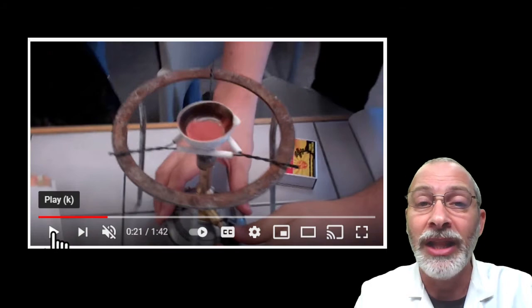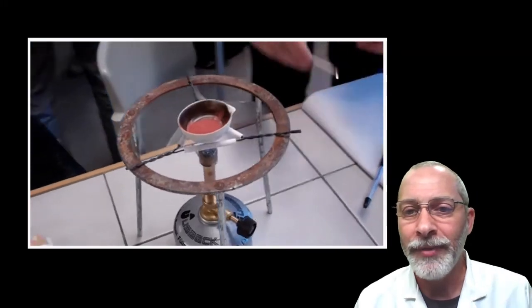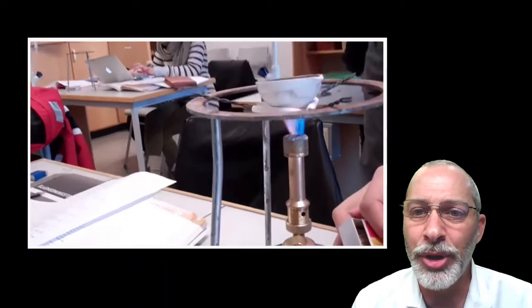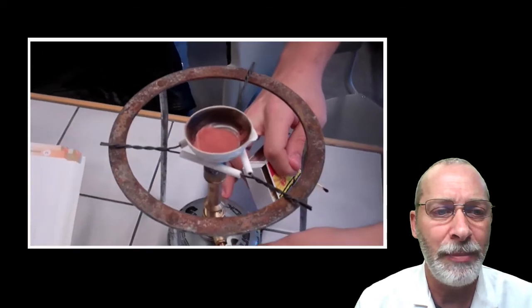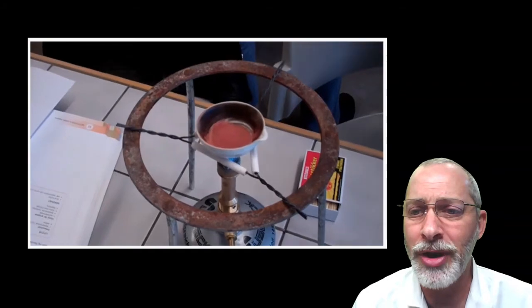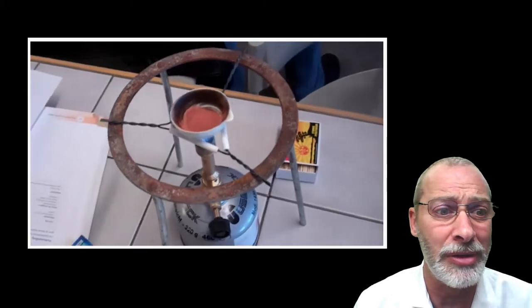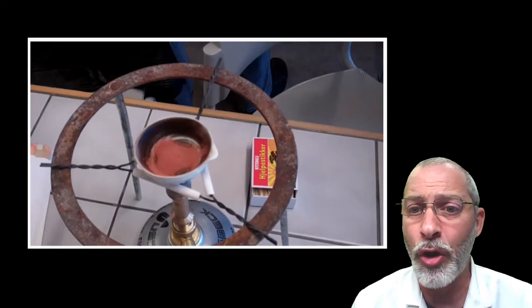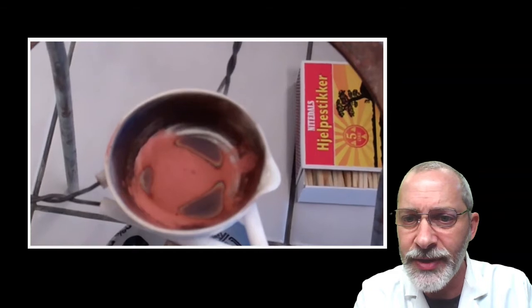So here we go. Let's watch what happens as this copper powder has been placed into a ceramic dish and a Bunsen burner has been lit underneath. And boy, we shouldn't keep an open box of matches near a lit Bunsen burner. Not too smart. I don't know if you noticed that young lady in the back in the laboratory with no goggles on. Oh my, look at all of that paper nearby, an open flame, not good. But let's focus in on this copper.